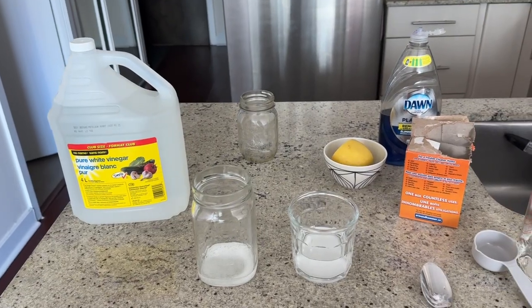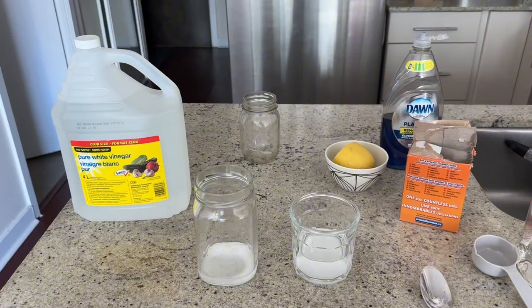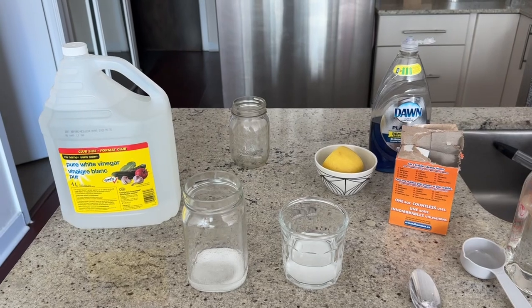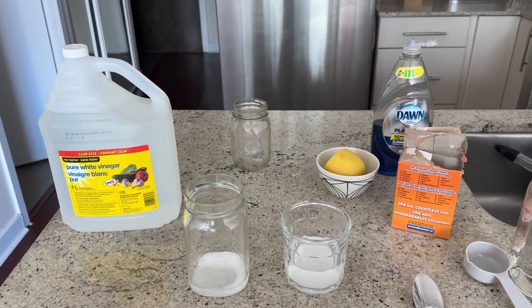So in summary, this acids and bases experiment is cost-effective, safe, visually engaging, and adaptable across grade levels. It transforms abstract chemical concepts into observable phenomena that students can analyze and explain.